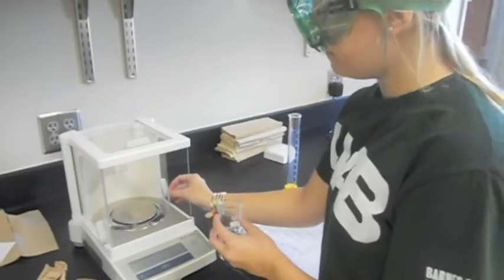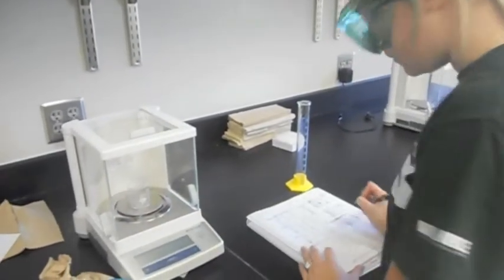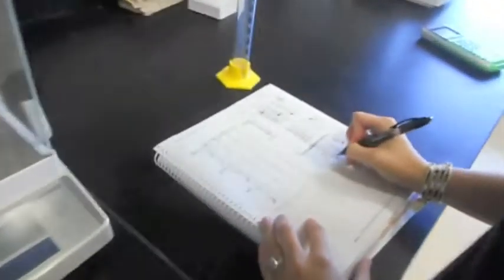First, you measure your beaker, and it's 28 grams, so you record 28 grams.